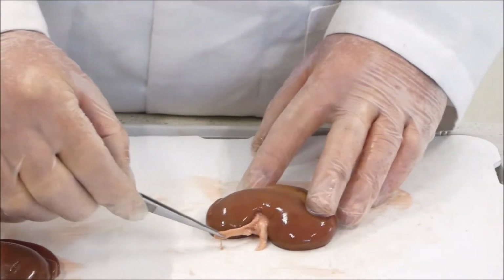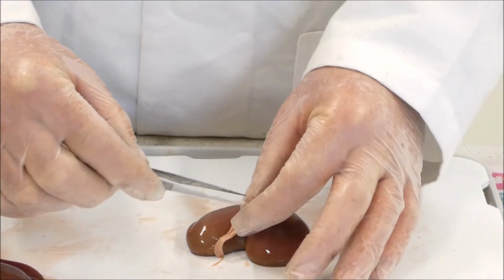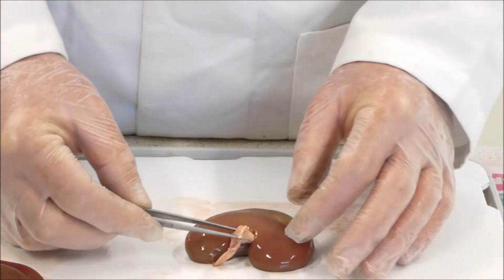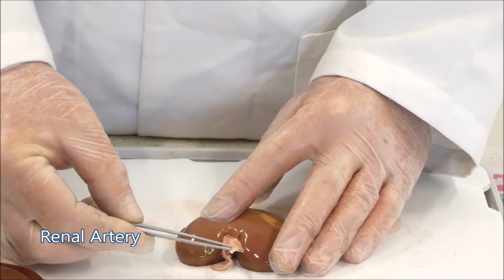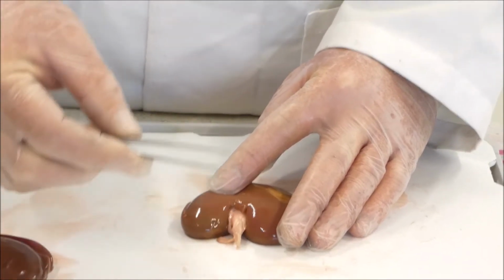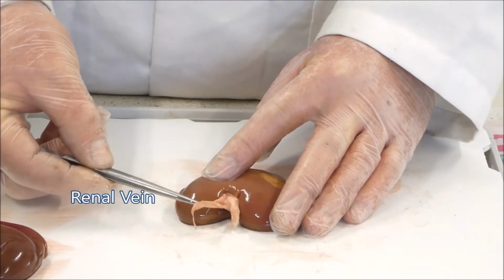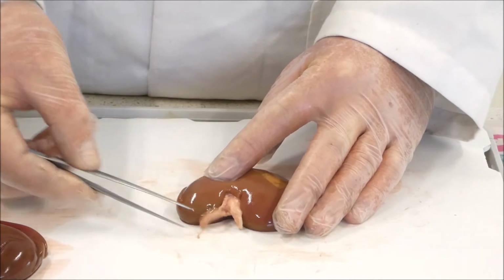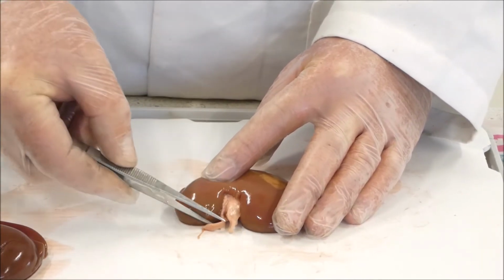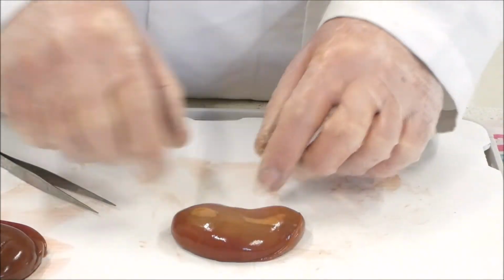Now there are two blood vessels that come out of the middle section of the kidney here. One is thick and muscular. And if you remember from your heart dissection, thick and muscular blood vessels are arteries. So that's the artery taking the blood to the kidney from the body. And the thinner blood vessel is the vein. So that is the renal vein taking the blood away from the kidney. So, renal artery and renal vein. Other than that, the kidney is pretty much uniform on the outside.